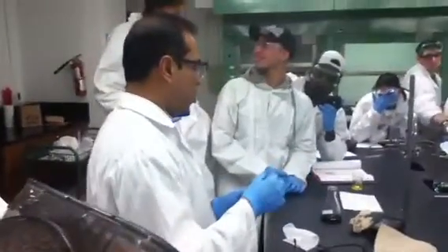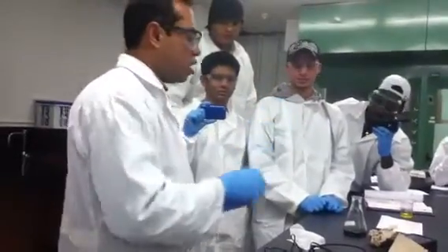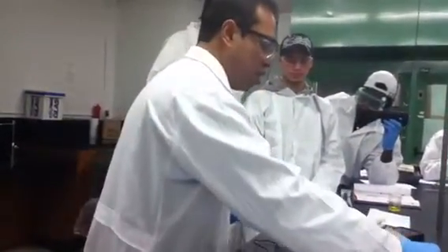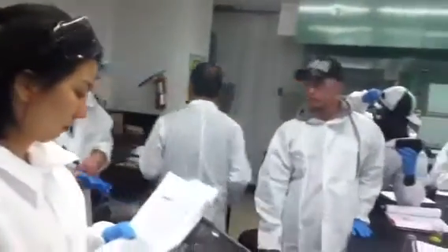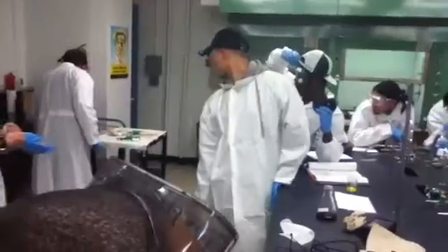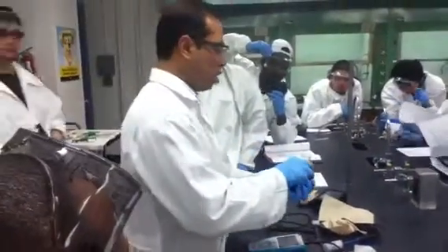Okay. I'm not sure whether that's the water or not. Give me some water also. This is water. This is the water over there. Professor, how did you get that? This is water. Oh, just we got the gold ore. Let me just show you the bottle in here. Where's that? So that's what it looks like.